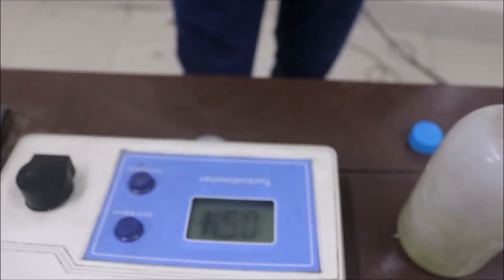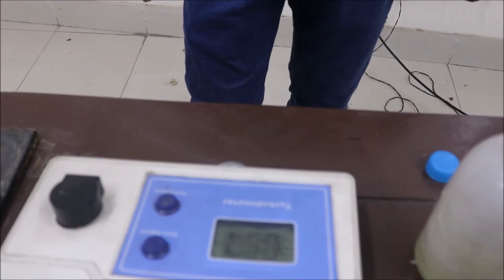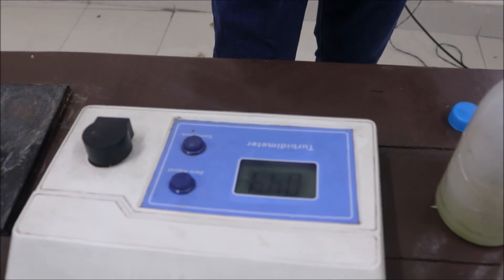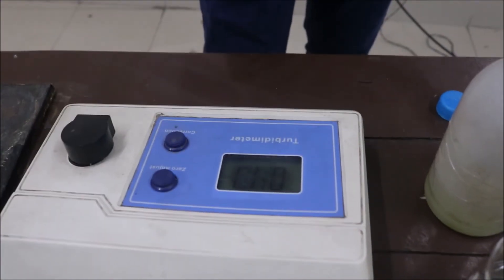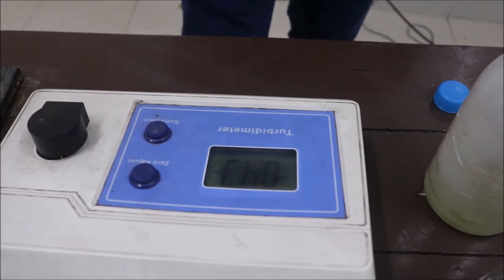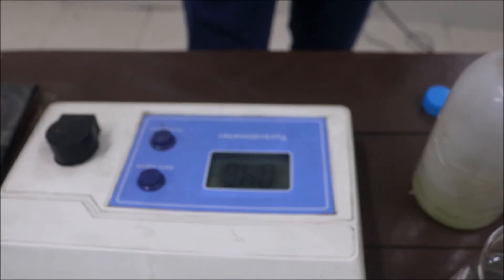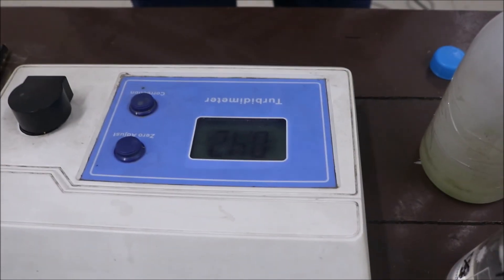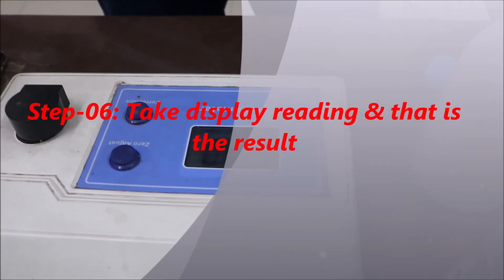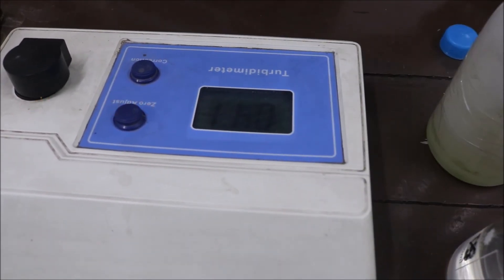This is 0.55 NTU. The reading is 0.43 NTU. The Rajshahi University of Engineering and Technology (RUET) Department result is 0.44 NTU.